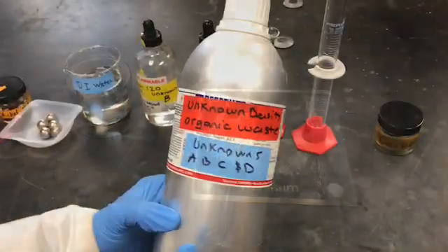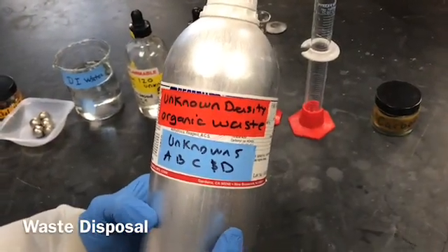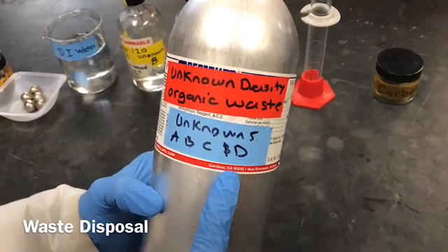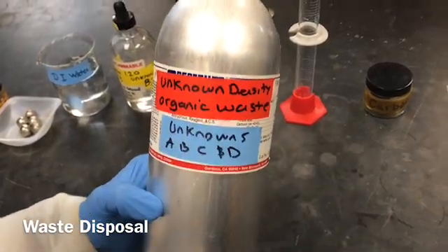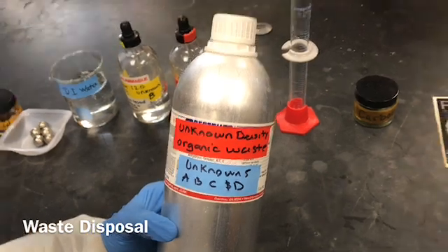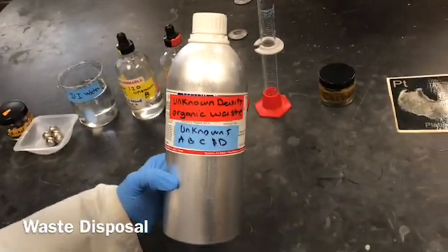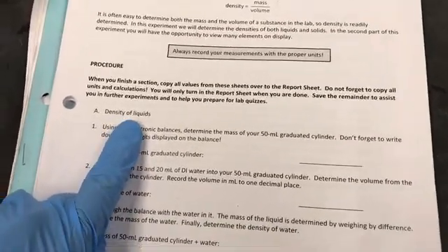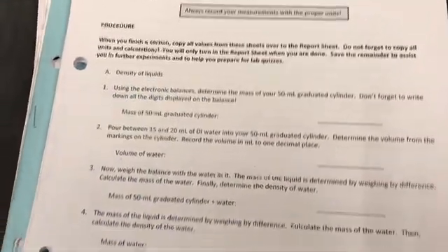We cannot dispose the organic liquids in the sink. So we have a special container to dispose of them, and this is the container I'm going to use to dispose of my used organic liquids B and D. So let's start with part A, density of liquids, and within that let's do the measurements for water.